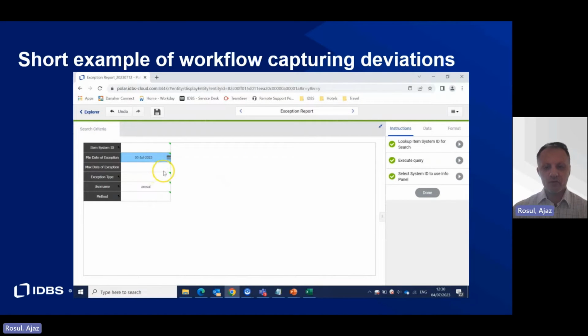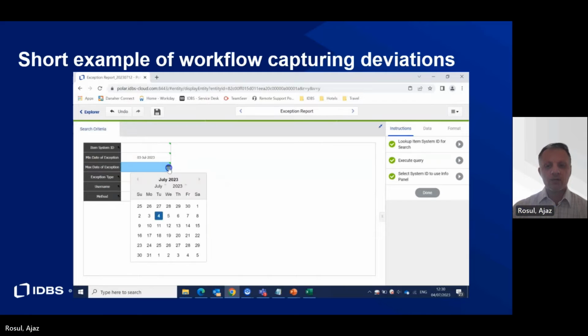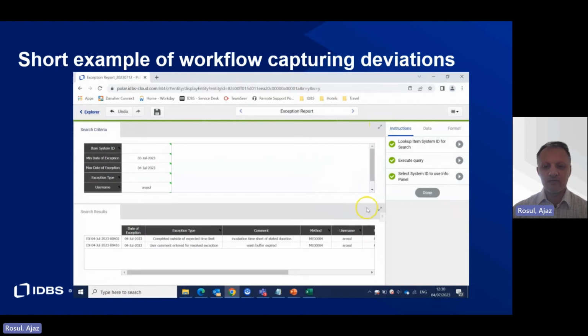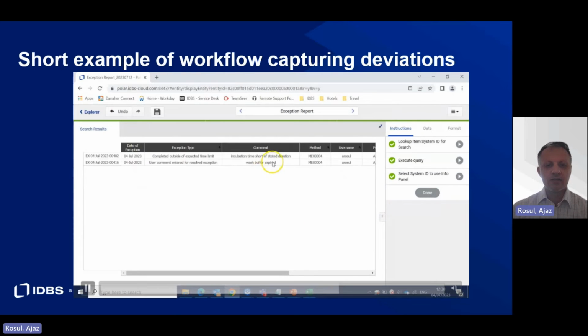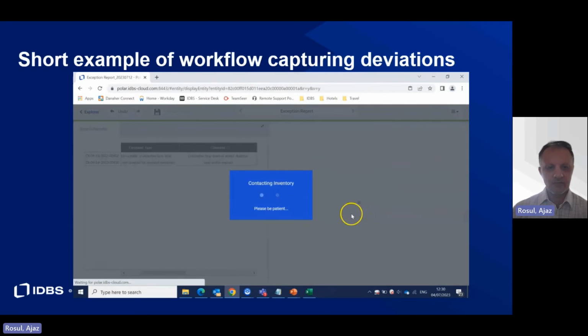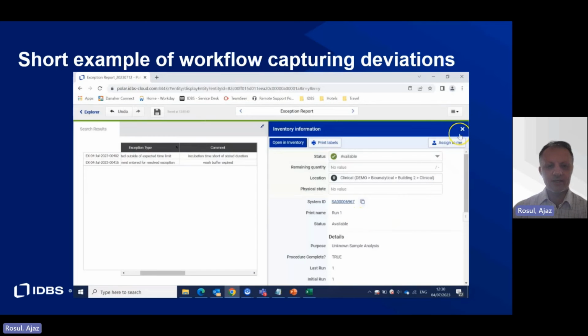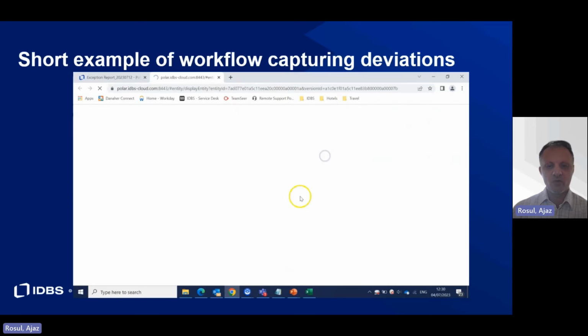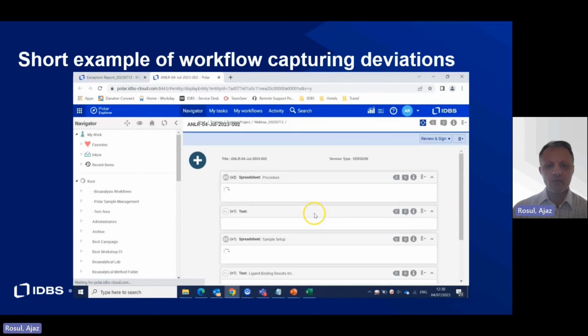As part of the review and approval cycle, the QA/QC team are able to generate an exception report, which highlights the deviations raised and directs the user to each study where the deviations were generated. The QA/QC team are able to set up a timeline for dates and specific users, and the information pulled in from the system will then highlight the actual deviations, so the QA/QC team can then review and confirm and approve the process.